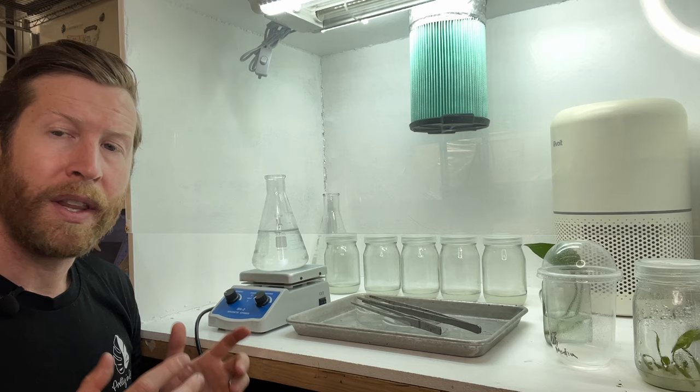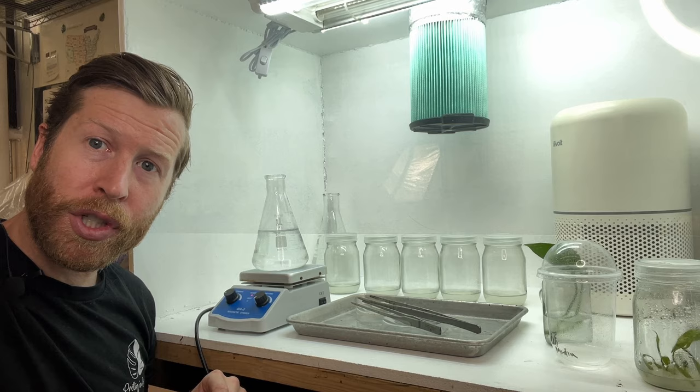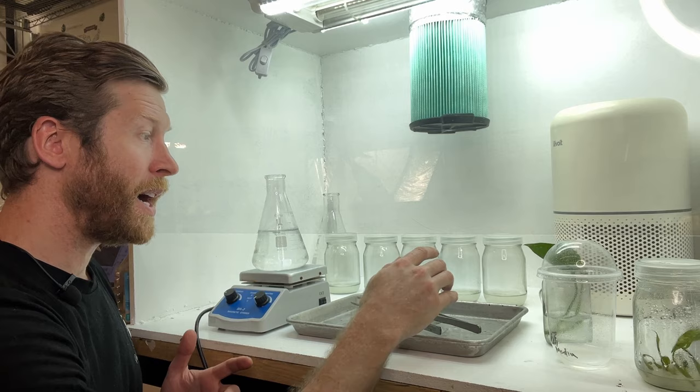This is a typical tissue culture lab setup. This box is called a laminar flow hood, and its purpose is to keep the area inside this glass sterile. This green filter is a HEPA filter, having air pushed from above by a fan to create a positive pressure across your hands. We have a sterile work environment here with some forceps or tweezers, as well as a razor blade. Back behind in the jars, we have a multiplication media where we're going to be putting our plantlets.